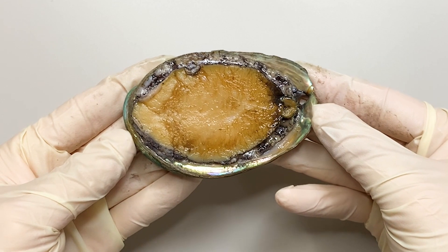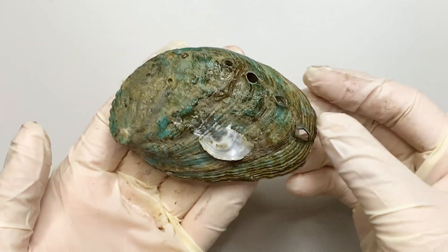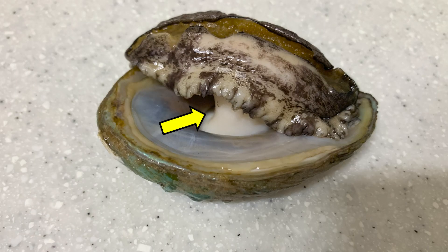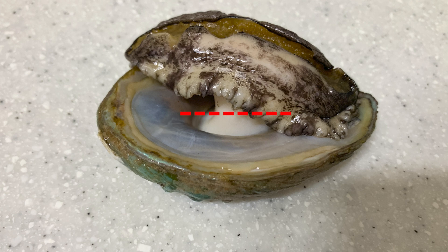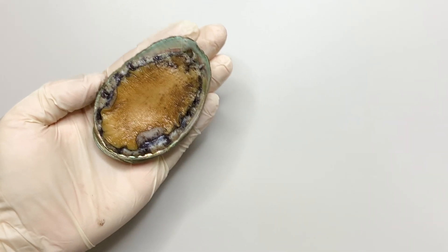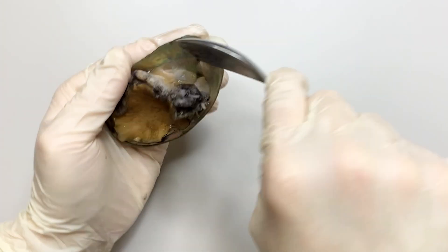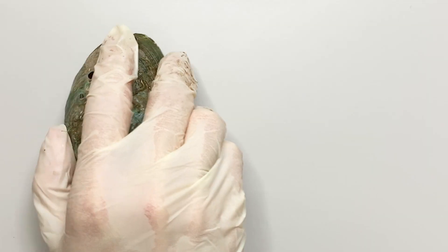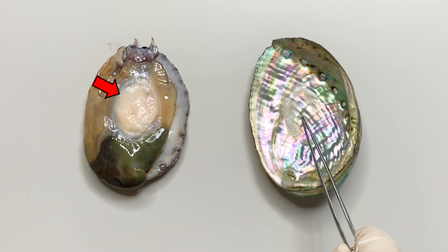Now let's separate the shell from the body to see the inside of the abalone shell. Abalone's shell and body are attached by a muscle called the shell muscle. So if you cut the shell muscle, you can separate the body from the shell. A spoon is a very good tool for cutting this. If you cut the shell muscle with a spoon like this, the shell is separated.